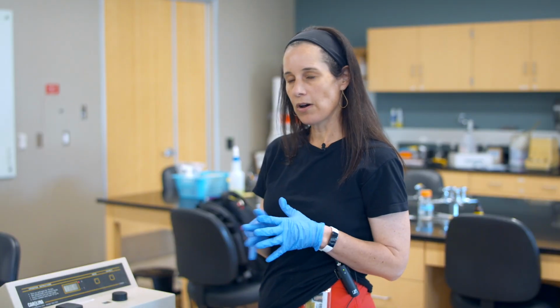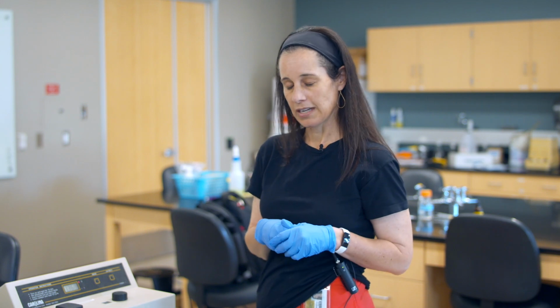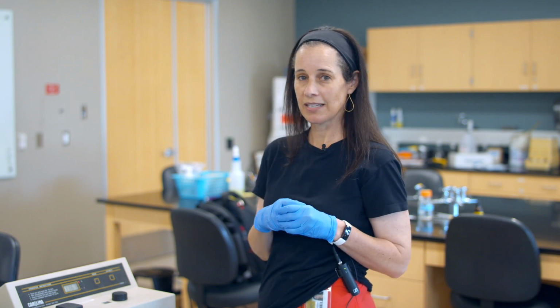So what we'll do is I will go ahead offline and give you all the data for our standard curve, and then show you how to analyze that data in Excel.